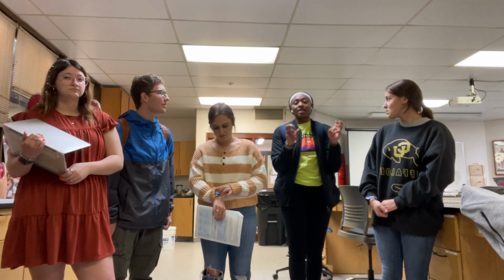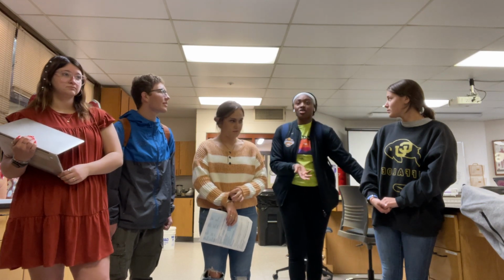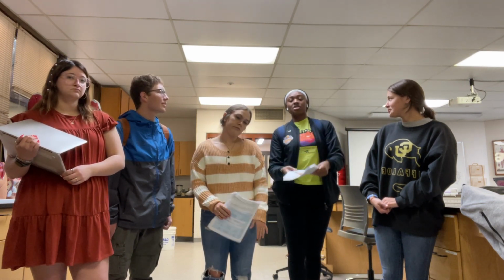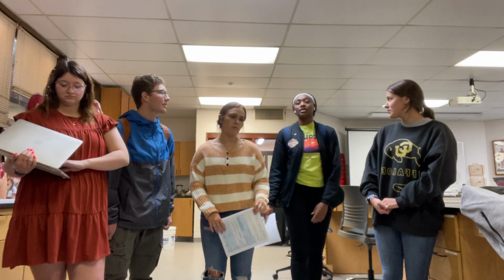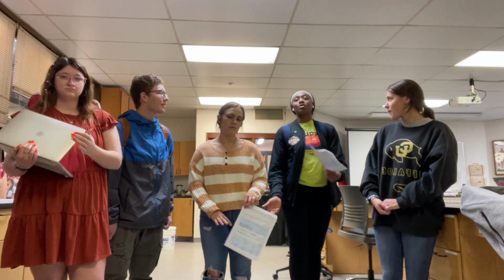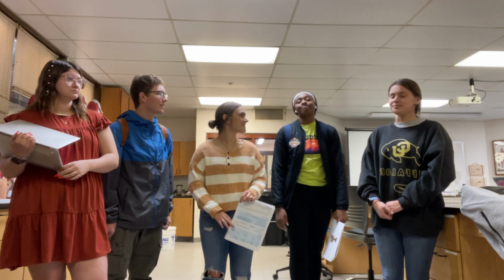kind of complex excretory system, whereas the perch fish has a kidney and it's also able to take away waste product from its gills and its skin, like taking away ammonia and other waste products. And I just felt that was pretty interesting.